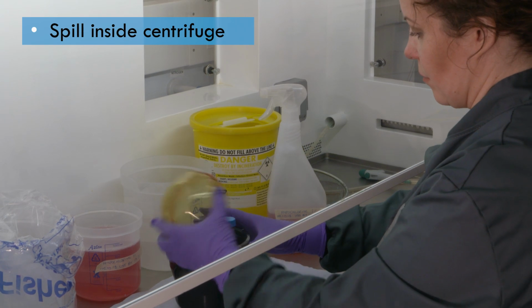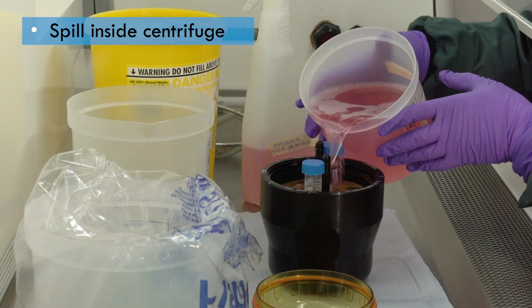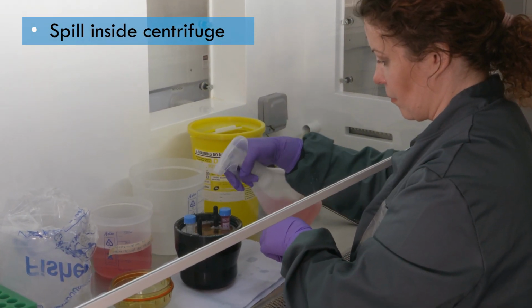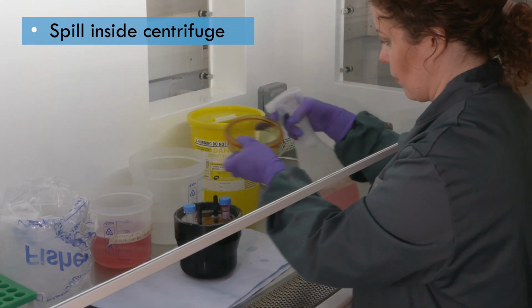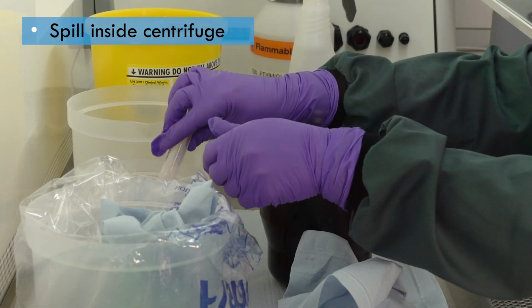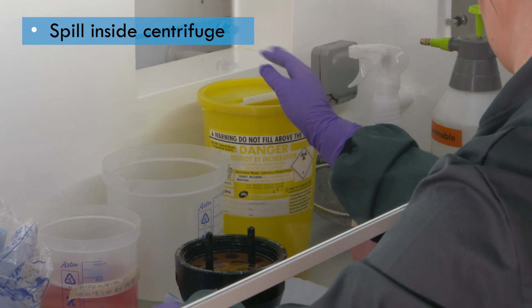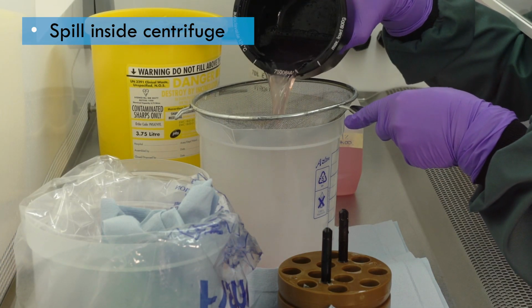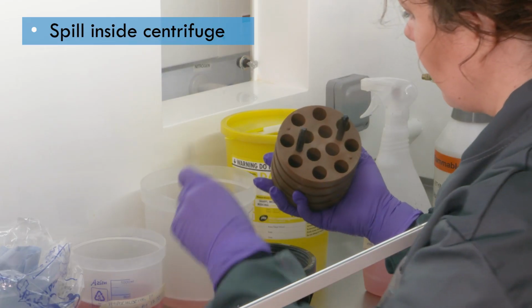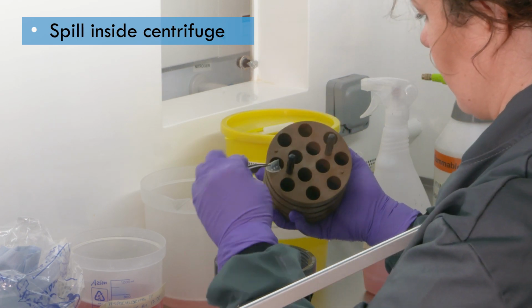Working in the biosafety cabinet, remove the lid of the bucket or rotor. Pour disinfectant into the bucket or rotor. Spray any unsubmerged parts and leave for the required contact time. Remove any unbroken tubes and discard them. Remove any large pieces of broken tube, then pour the contents of the bucket or rotor through a sieve to capture any small pieces. Using forceps or tweezers, place broken pieces directly into a sharps bin.